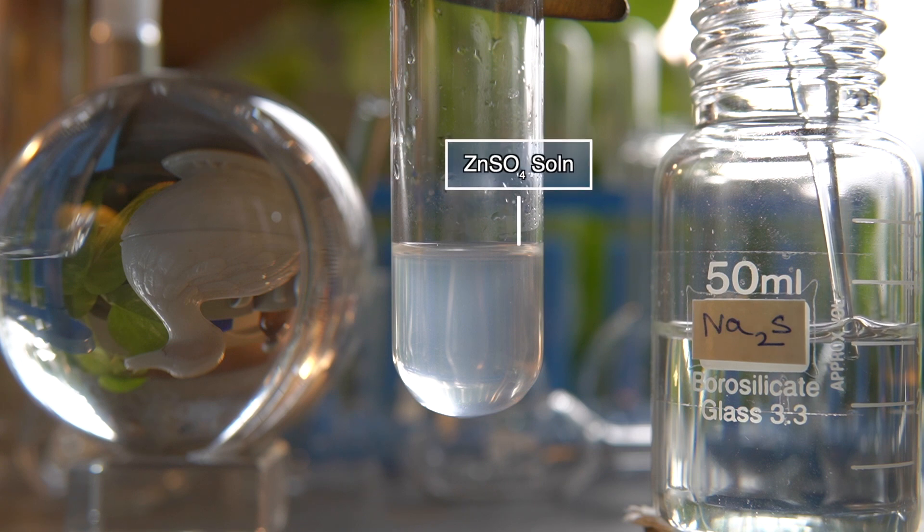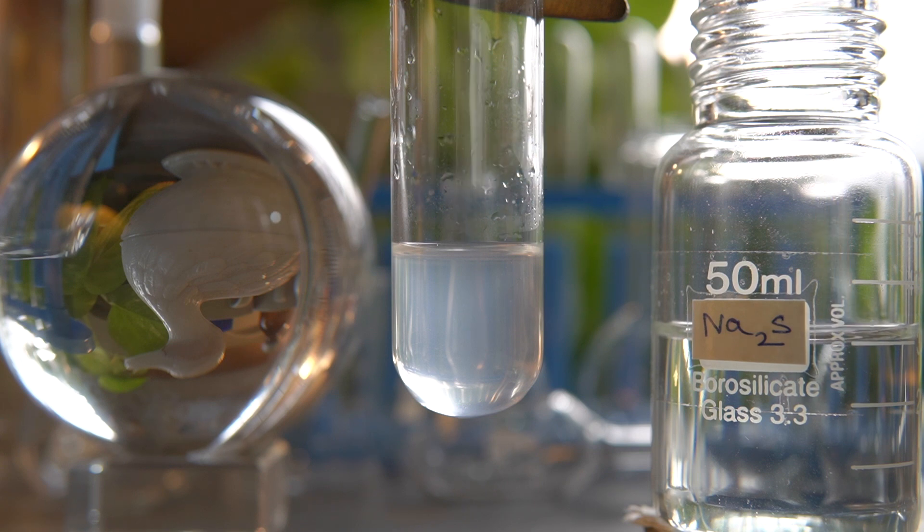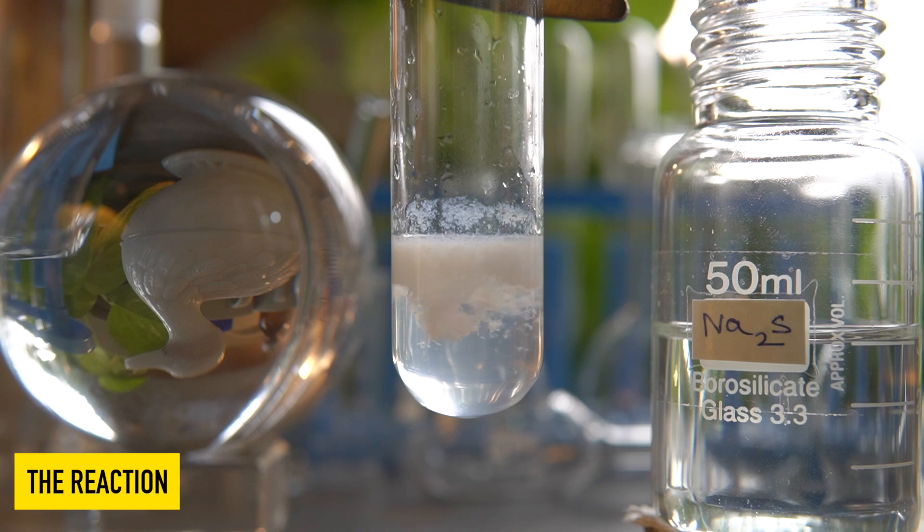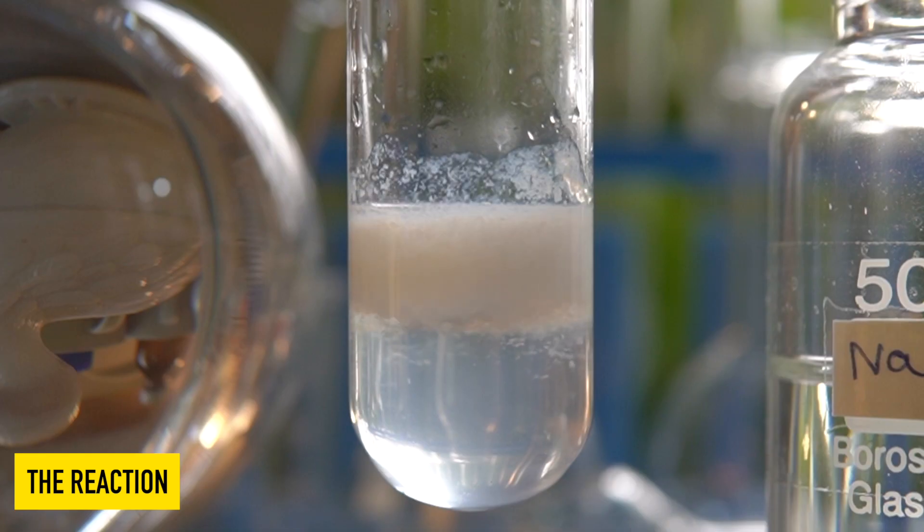Now we will add aqueous solution of sodium sulfide dropwise on zinc sulfate solution and observe the effects.